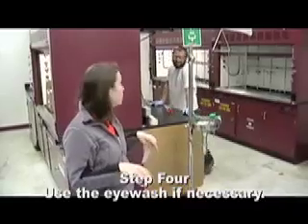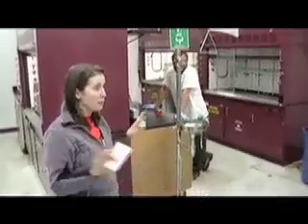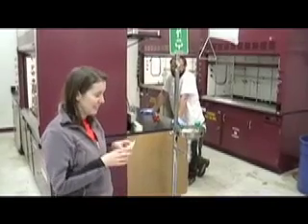And if there's no one in the room, start screaming. But if you're alone and there really isn't anybody else around, you should shower first before you call safety. Safety will still come.